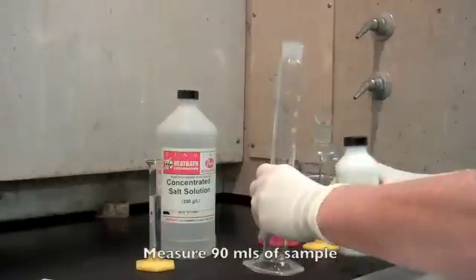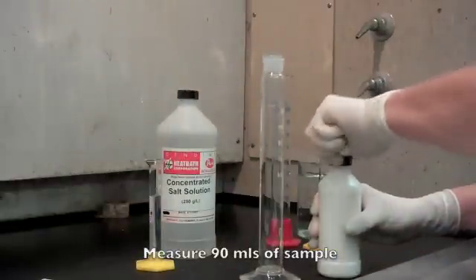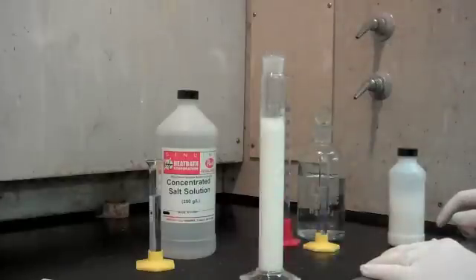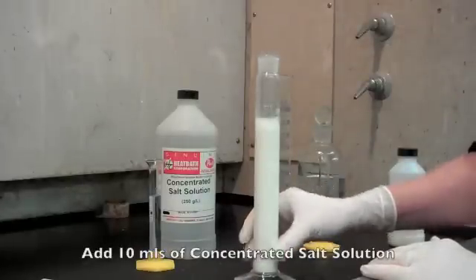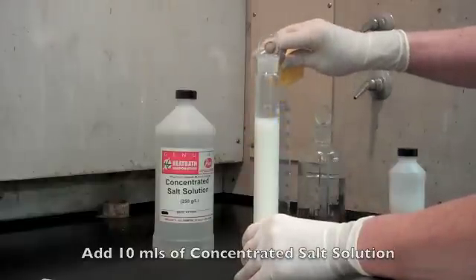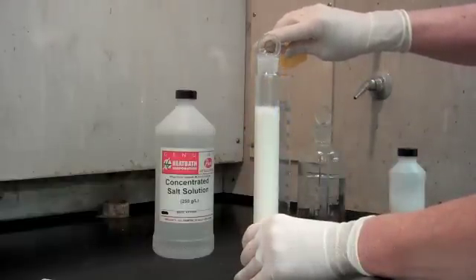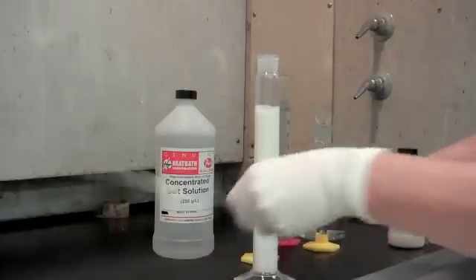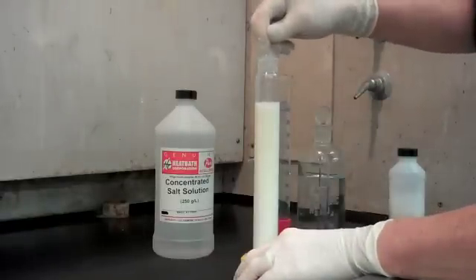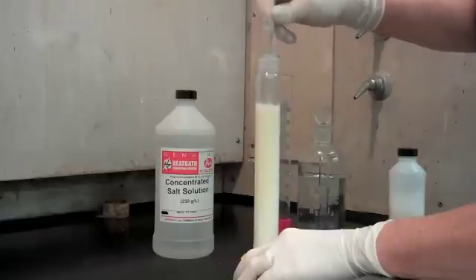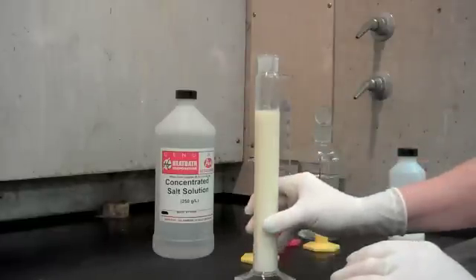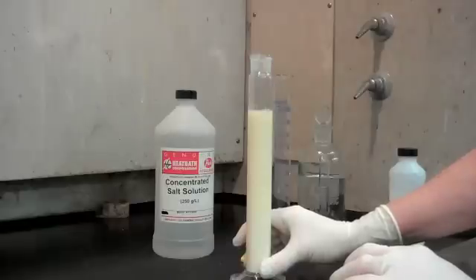I'm going to measure out into a graduated cylinder 90 mL of the sample. In this first test, I'm going to add 10 mL of concentrated salt solution. You want to mix it very well. This will take a little while for it to split.